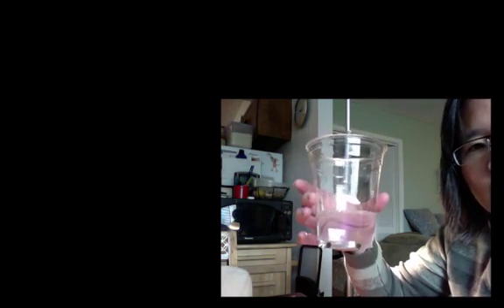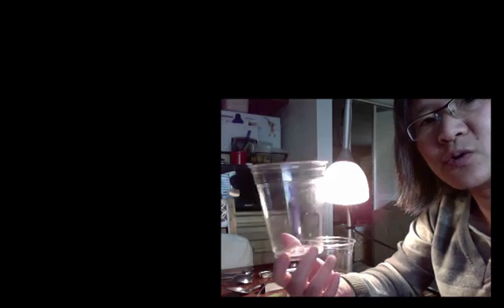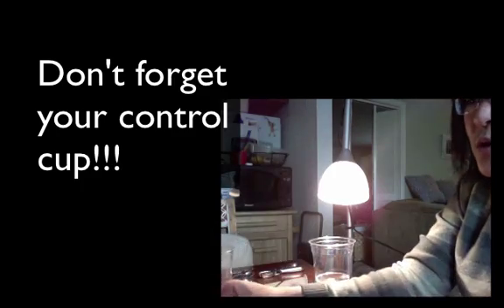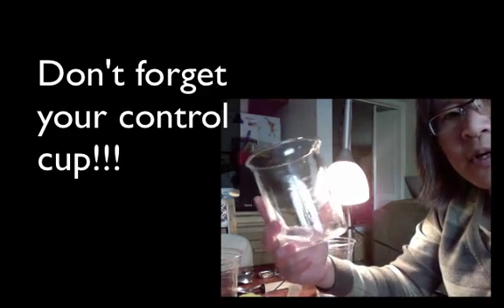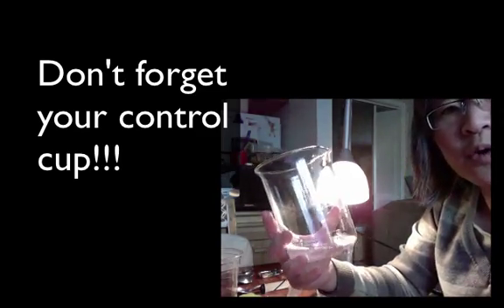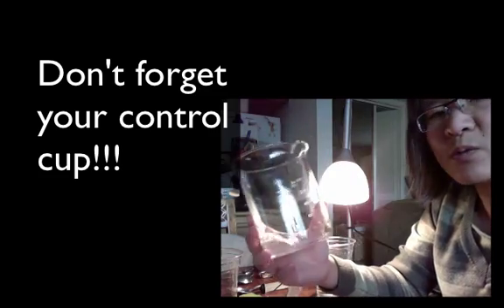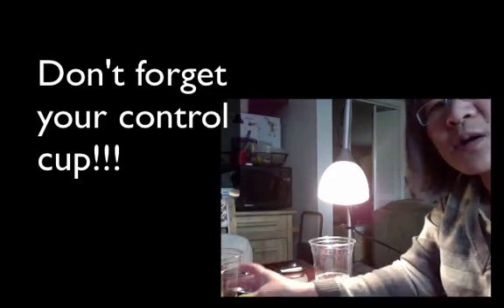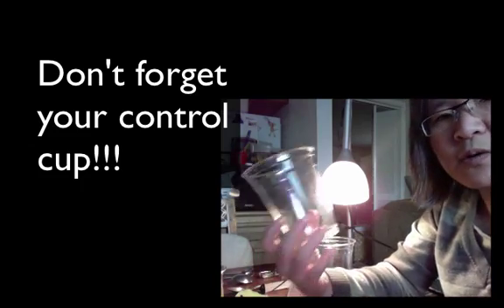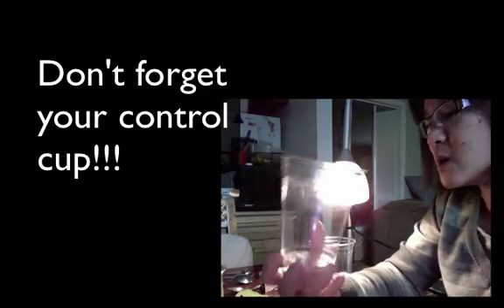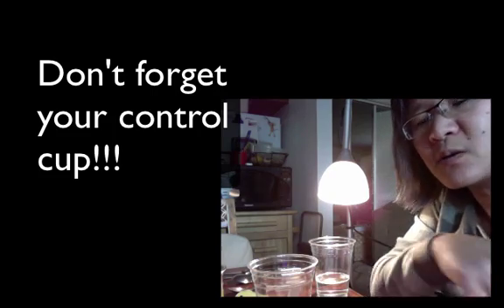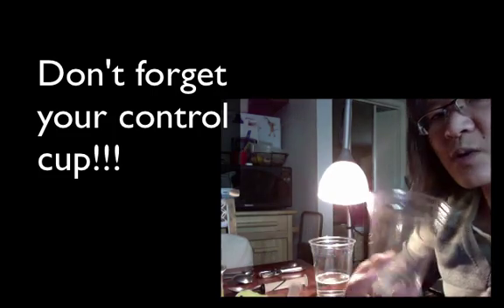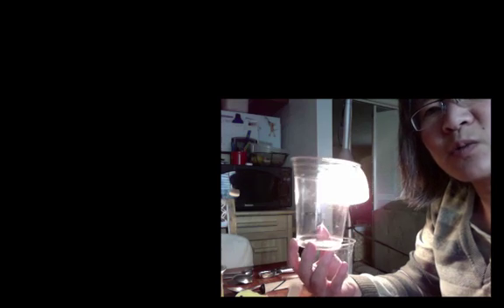Okay, so it's been a couple of minutes and there's still no floating leaves. Okay, but it takes a little while for photosynthesis to actually take place, the oxygen to build up and to get those leaves to be buoyant again. One thing that you can't forget is that you also need to have a separate cup that's your control and in your control instead of your bicarbonate and soap and water, you're just going to have soap and water. Okay, one drop of soap and 300 mils of water and then you're going to use that to infiltrate a new set of 10 leaves. Okay, because you can run the control at the same time as you run this test experiment. The reason why is that you need to basically see without the carbon source that these are not going to rise as quickly as you would expect them to if they had an active carbon source like the bicarbonate that you're using.